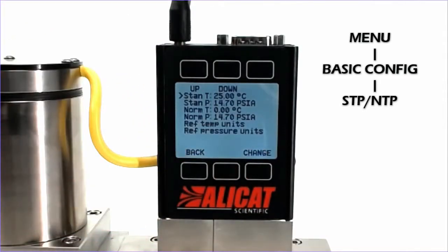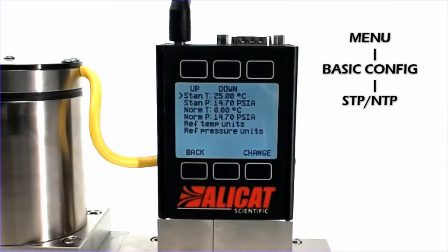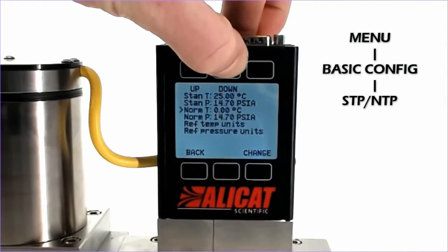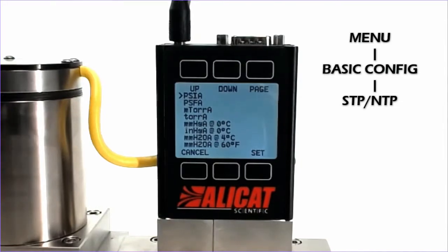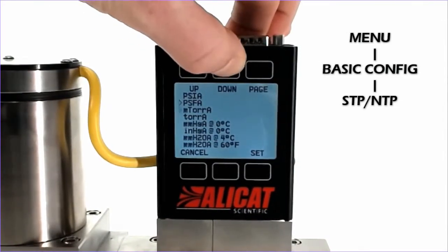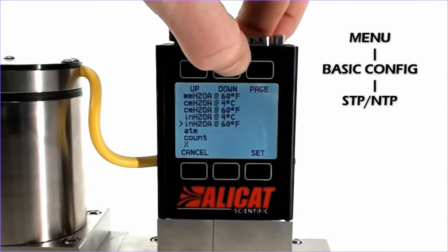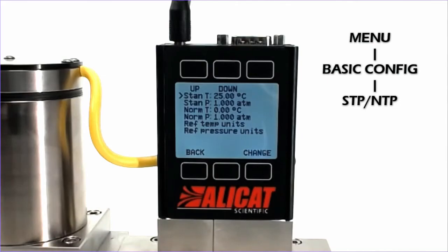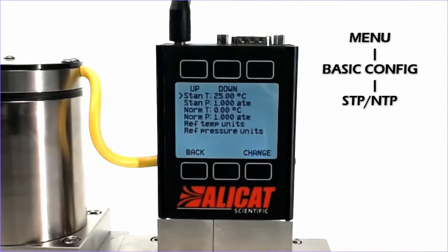Say we like that standard pressure of 14.7, but we want to work in atmospheres. We will just scroll down to reference pressure units, hit Change, and we see a long list of different units here. We will scroll down until we hit ATM, hit Set, and now we see that our STP is set at 25 degrees Celsius in one atmosphere.